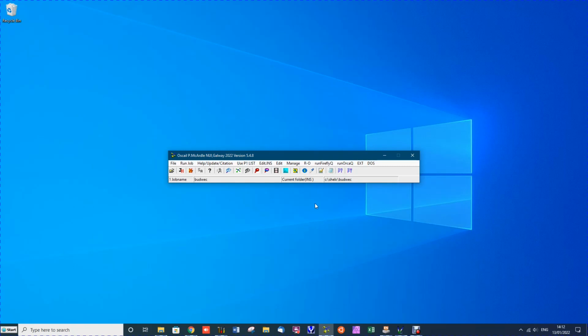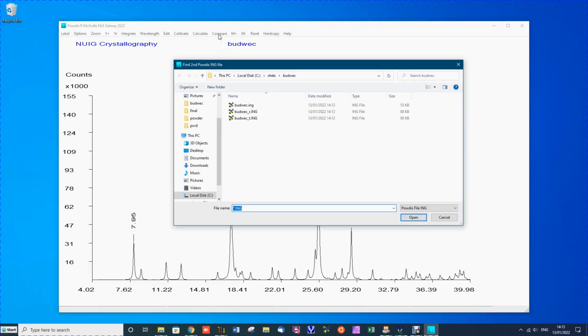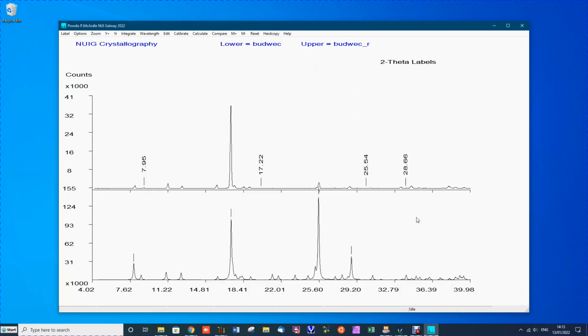Now we can redisplay the pattern we just calculated, and we can compare this to the patterns that were obtained by reflection mode and transmission mode. Reflection mode is the more common. We look at it first. In reflection mode, one peak dominates the pattern. We can clear the labels which are no longer relevant to this pattern.